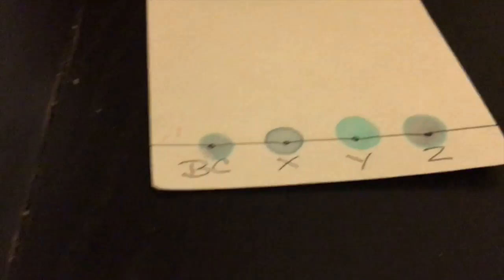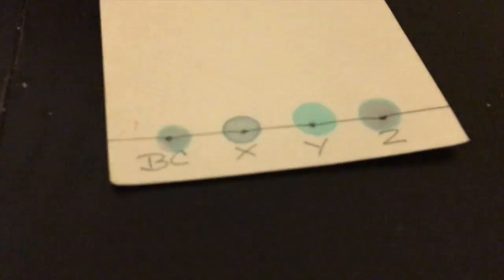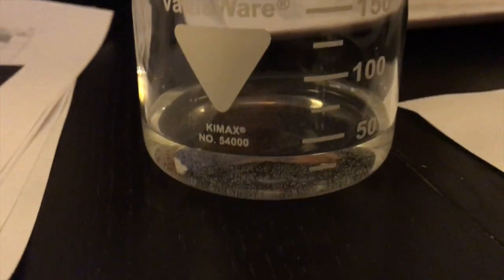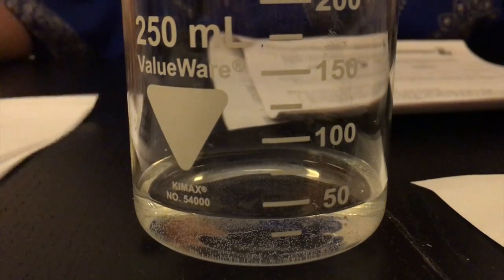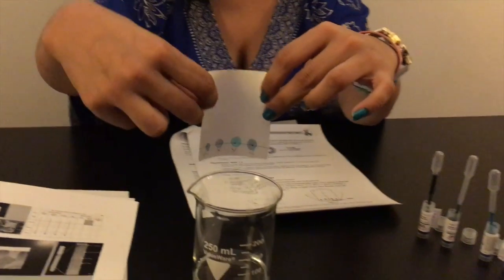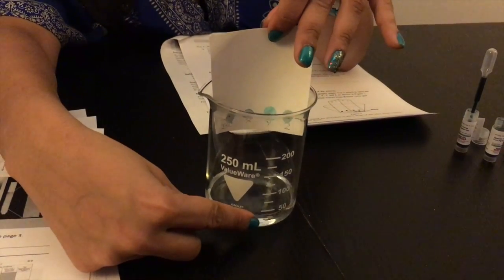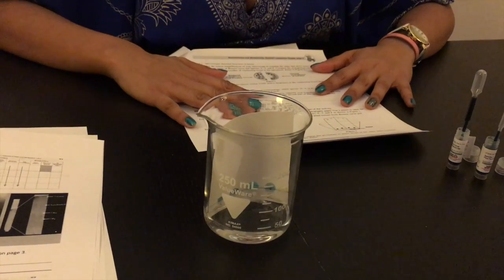The paper will have a line along the bottom and be labeled. Students place each pigment on each dot. Once they have done that, they are ready to put it into the beaker of water. Ask students to fill the beaker up to the lowest marking so it has just enough to touch the bottom of the paper and no further. Once the paper is labeled with all pigments in place, bend the paper slightly and curve it so it fits into the beaker, then place it in and wait for the pigments to rise.